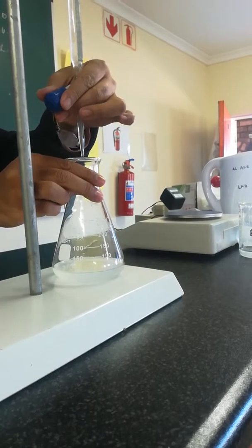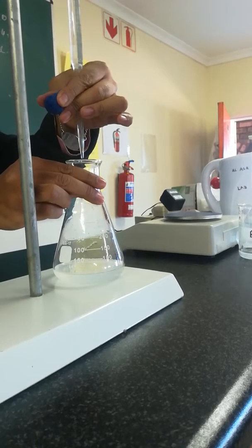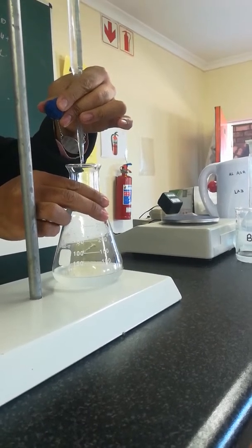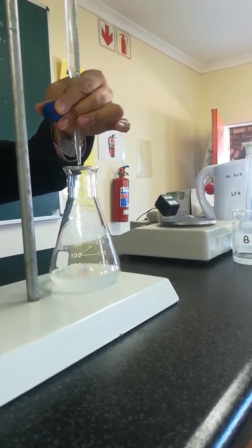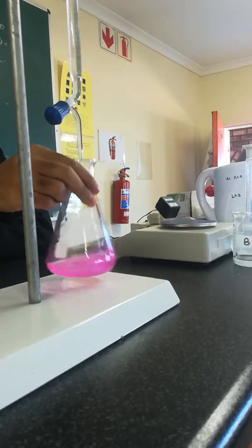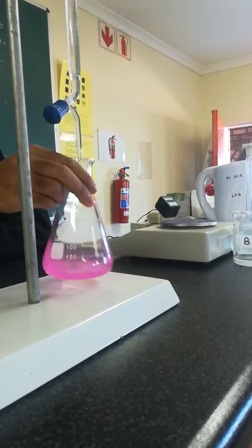So now we take one more drop. There's one drop. Let's see. One drop.